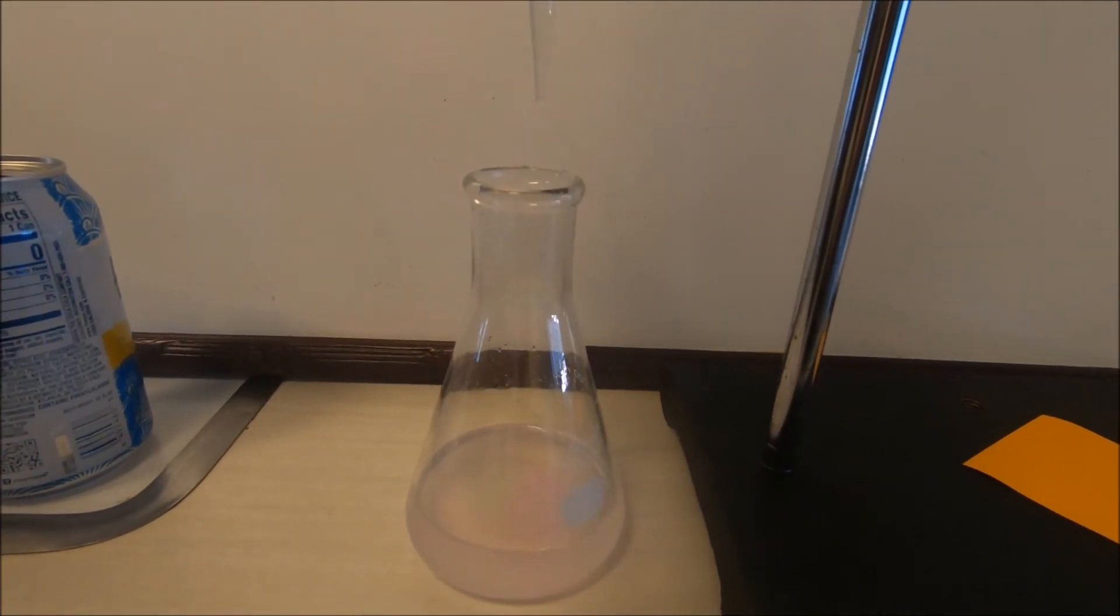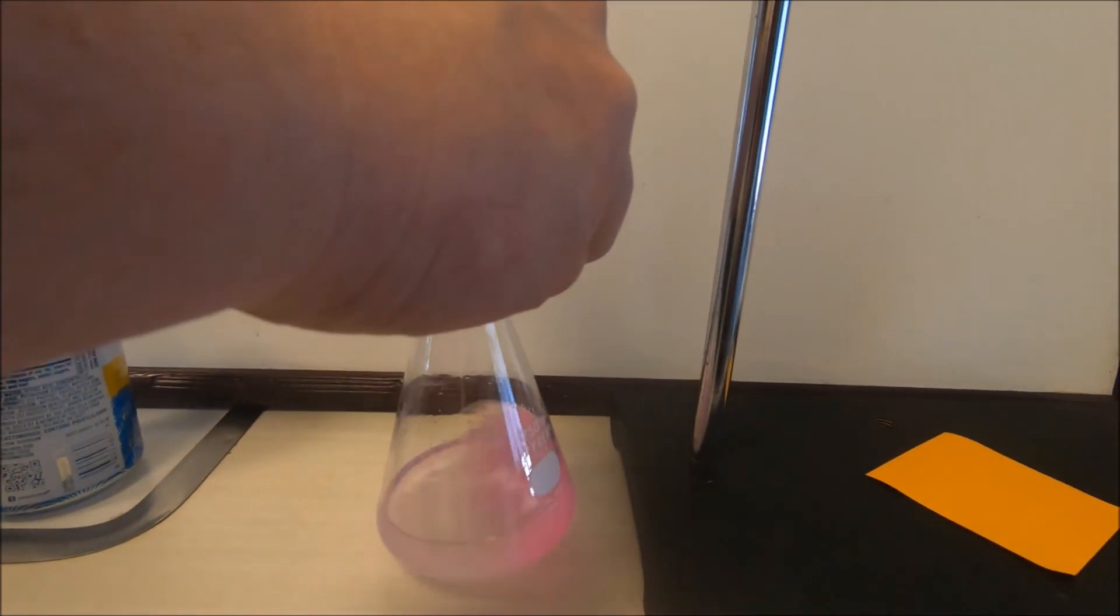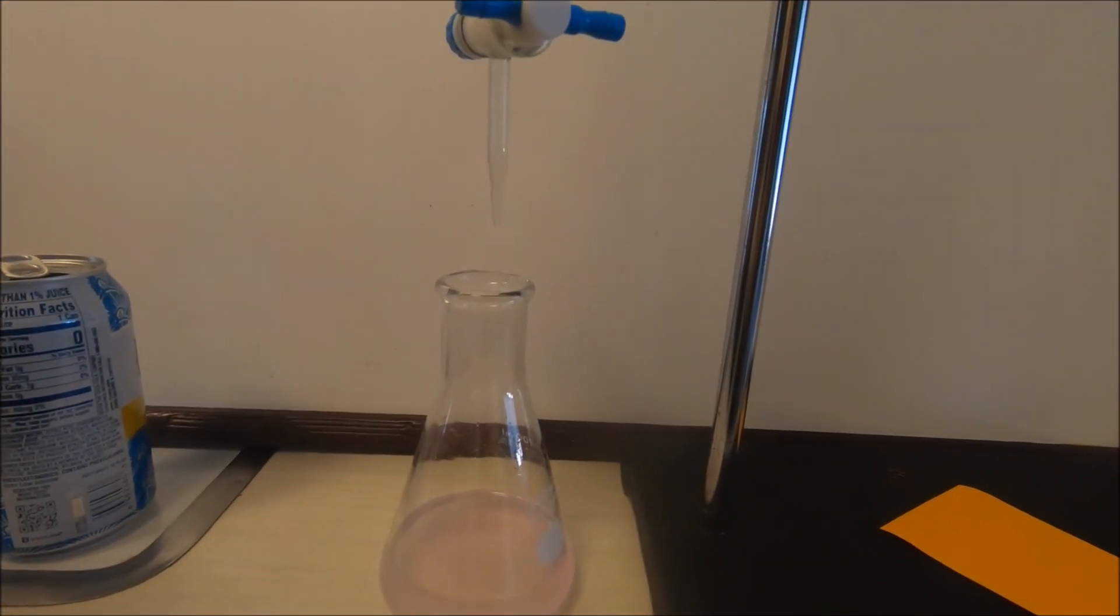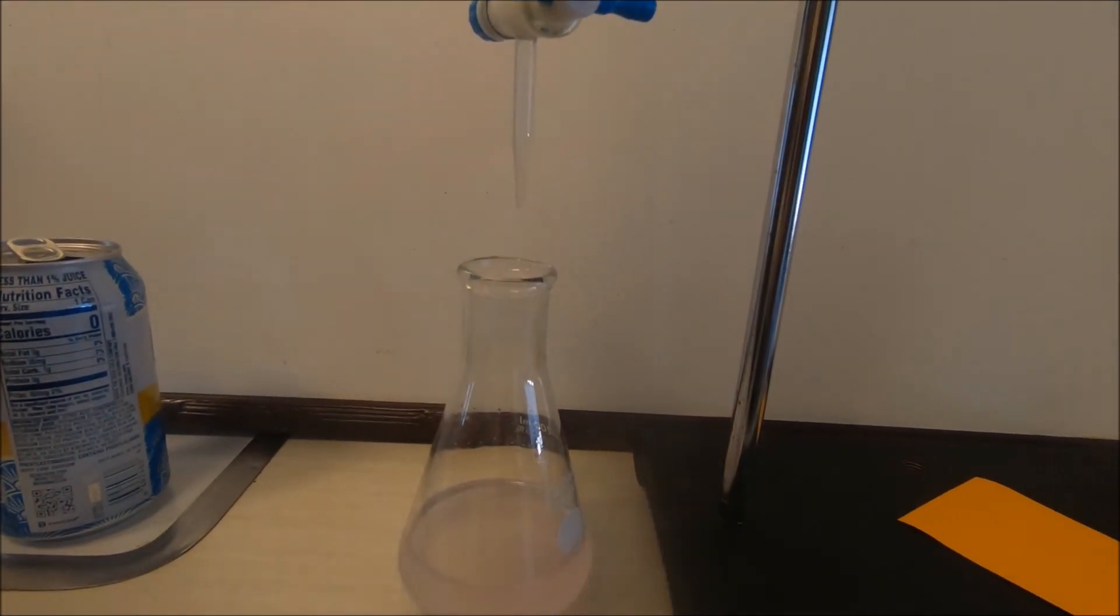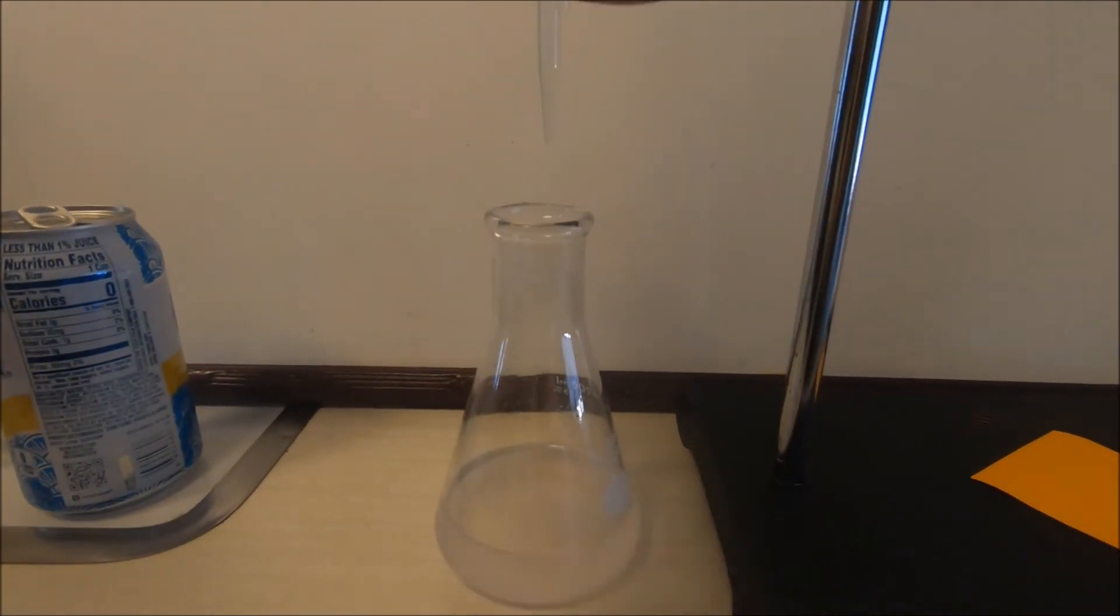For it to fade, and a couple more drops. I think we're at about that point where after about 10 seconds we've lightly faded away to having that material back to the original color.